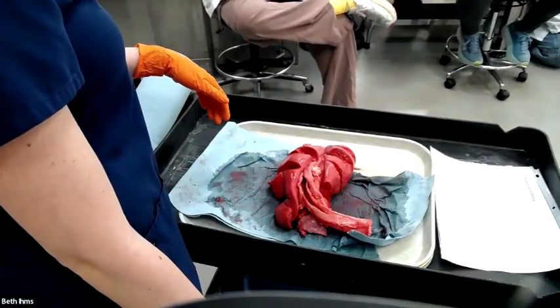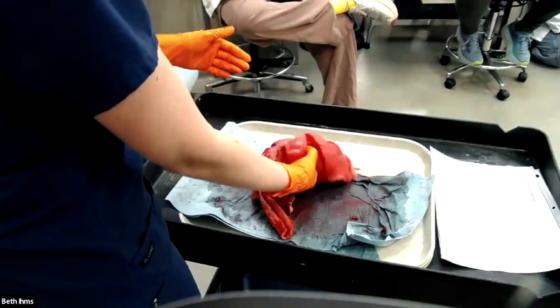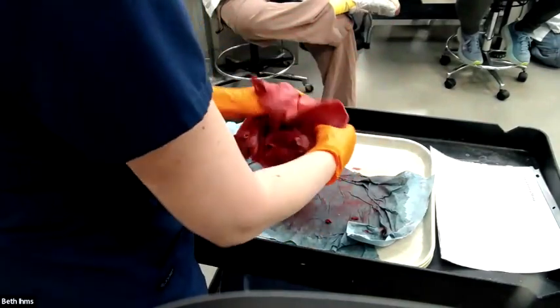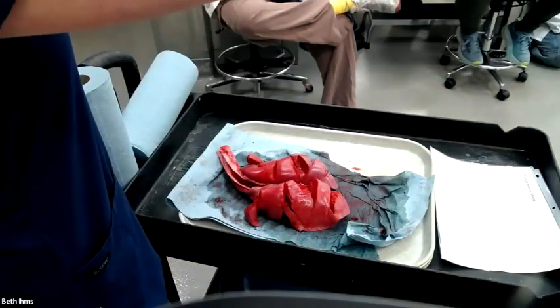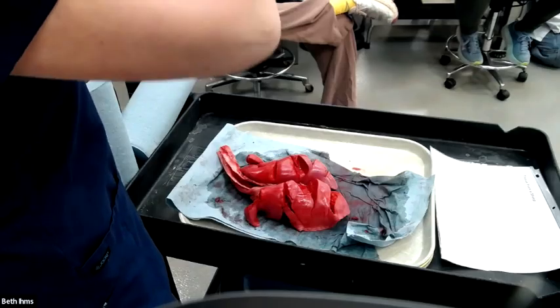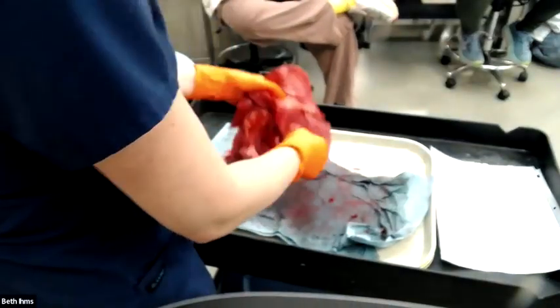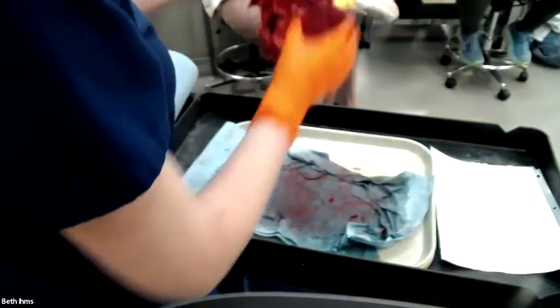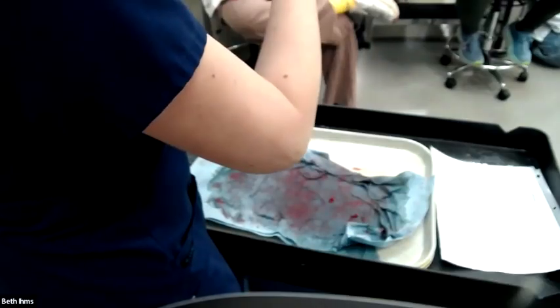Is that like a normal color lung? This is a normal color and it's a fairly normal texture. I showed a couple people the way to correctly fondle a lung. You want to take the lung tissue like this, take your hands like this, and gently slide it through your fingers. It's very sensual, the lung. You don't fondle a liver like that. The liver is more of like an S&M kind of thing. It wants aggression. The lung, be gentle. So you're going to kind of go like this and just kind of fondle.